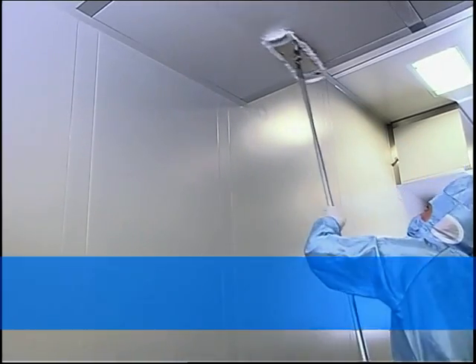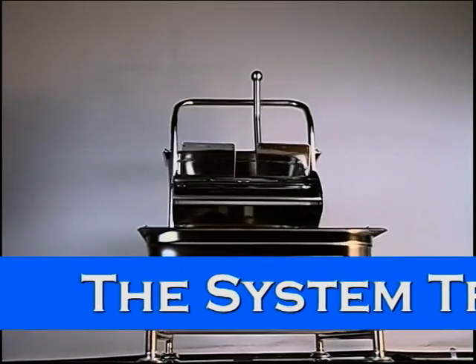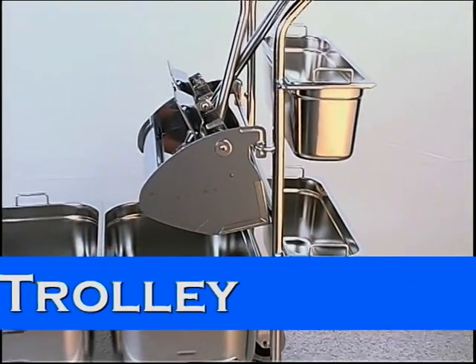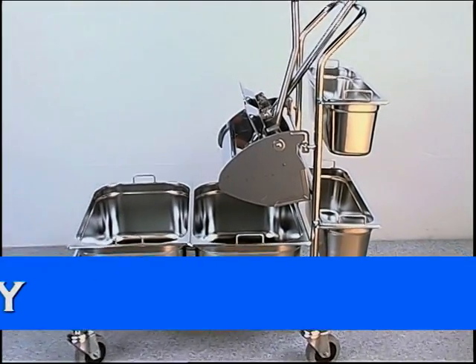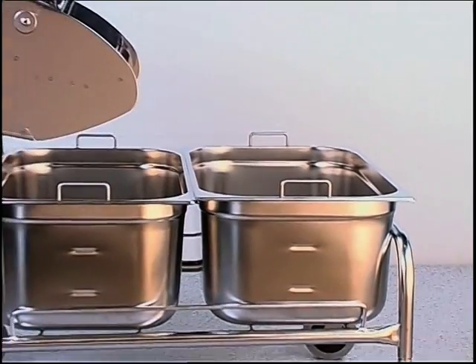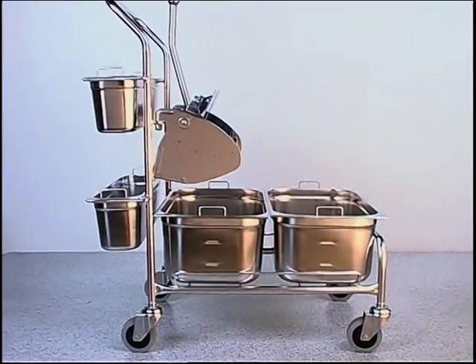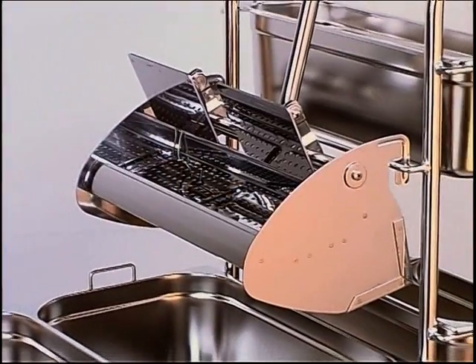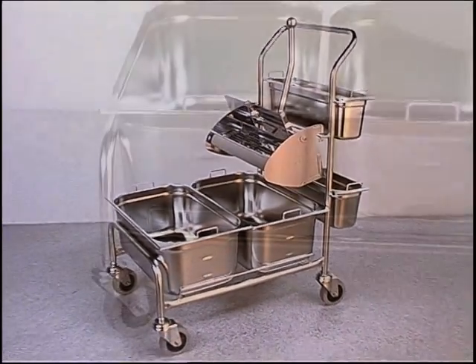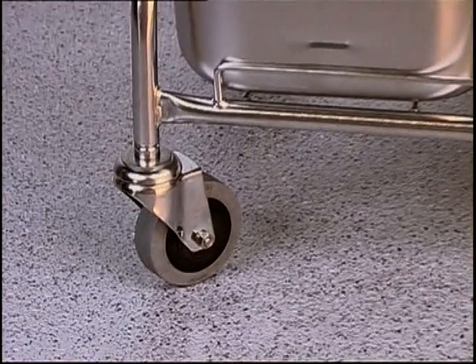Before we come to the correct and economical cleaning and disinfection of surfaces, I would like to present the new system trolley. Its special construction permits quick and easy working practices. The containers are arranged to simplify working in a logical order. And how does the teamwork function with this system trolley? The removable tubs are simply hung up in the basic chassis. The trolley itself runs on low friction wheels on axles which are, of course, grease-free.